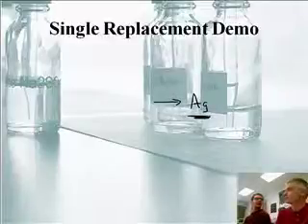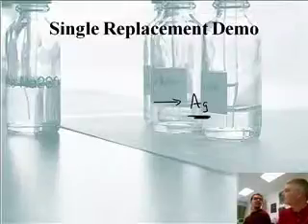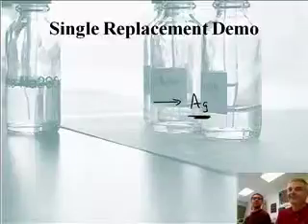So actually one thing that's very cool about these reactions is you tend to get these sort of precious metals in their pure form out. So actually maybe you're not so ugly after all. Maybe you're actually a precious metal.